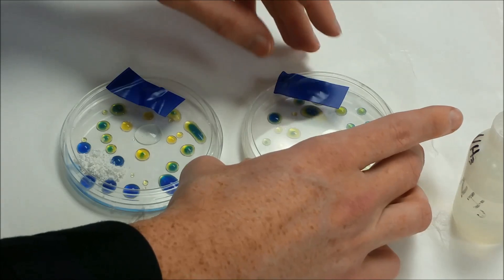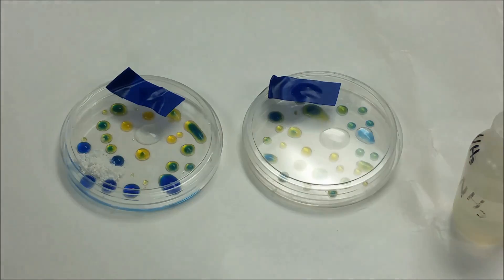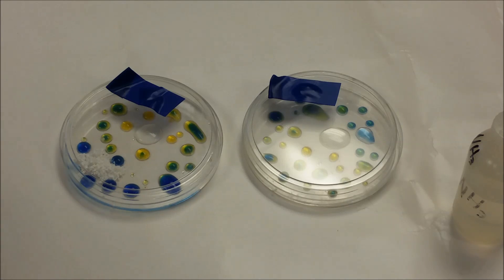You can quickly see that that's now changing back from the acidic form to the basic form, as that basic gas now travels throughout the Petri dish.